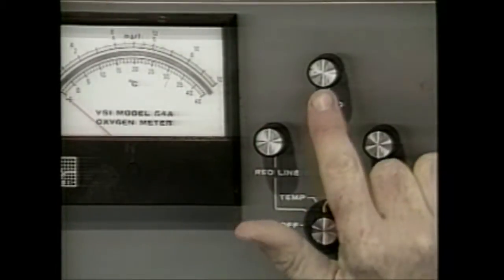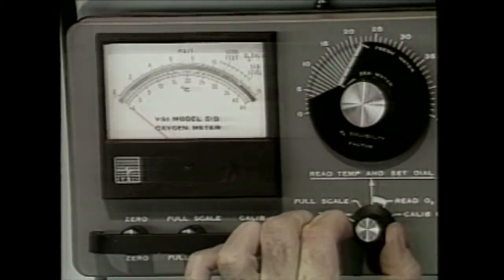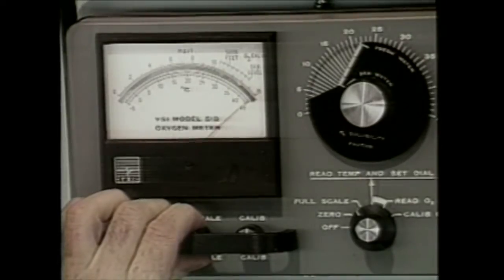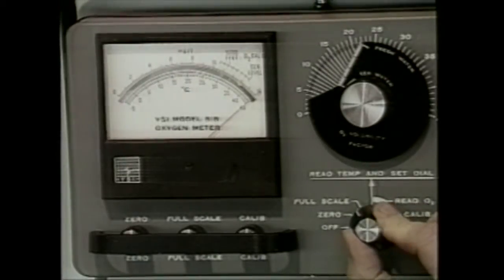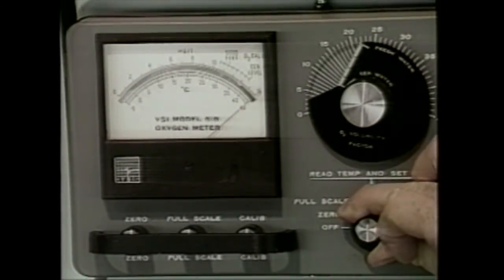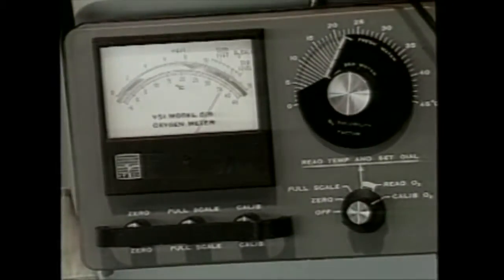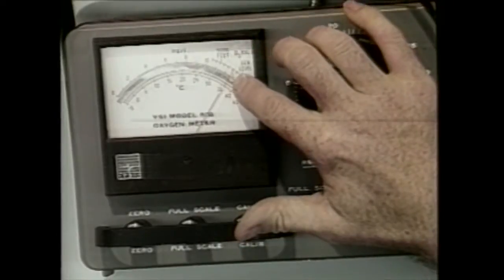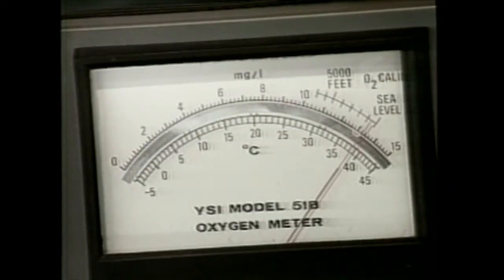A 15-minute warm-up period is required by most oxygen meters to polarize the probe. The probe should be wrapped in a wet cloth or paper towel during the calibration procedure. Switch the meter to the zero position and adjust the knob so that the needle is at the zero position on the scale. If your meter has a full scale knob, switch it to this position and adjust so that the needle reads 15 milligrams per liter on the scale. This adjustment is a check for battery strength. Therefore, if a full scale reading cannot be obtained, the batteries need to be recharged or replaced.